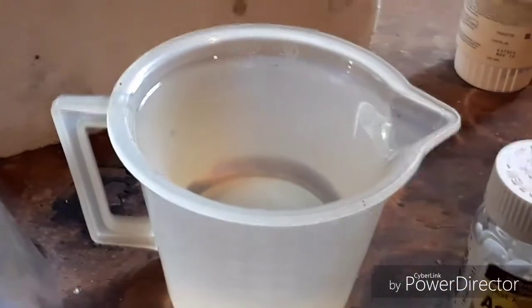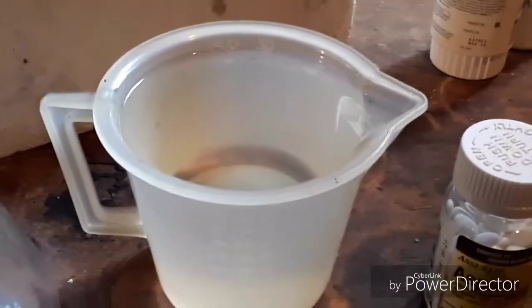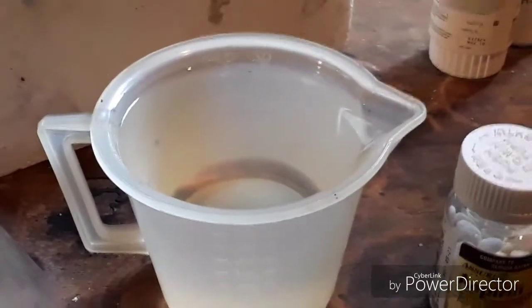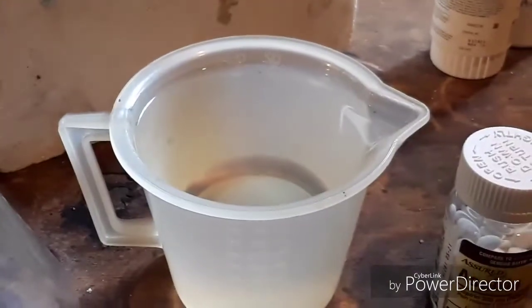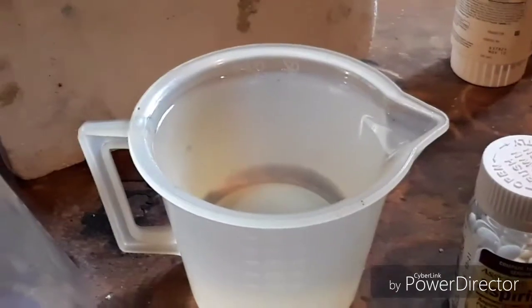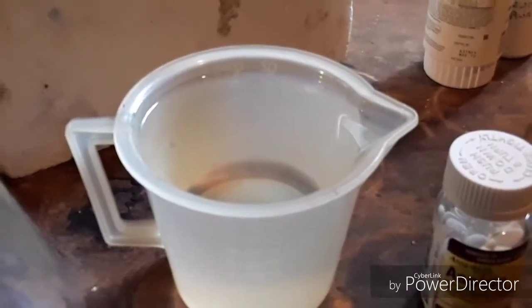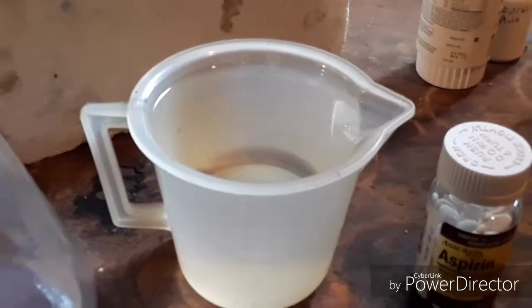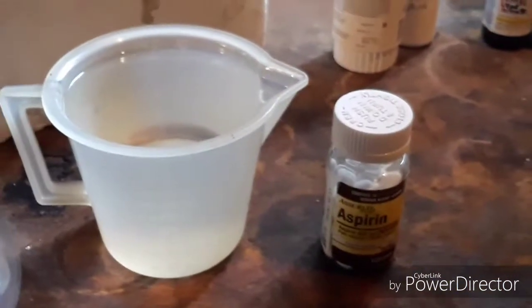We need our aspirin, and in this measuring cup here I have measured out 500 milliliters of ethyl alcohol. This is actually denatured alcohol, because in the United States, ethyl alcohol — unless you want to make it or distill it yourself — is not as easy to come by as it is in Canada, Australia, or the UK. Those are the only two reactants we are going to be using.